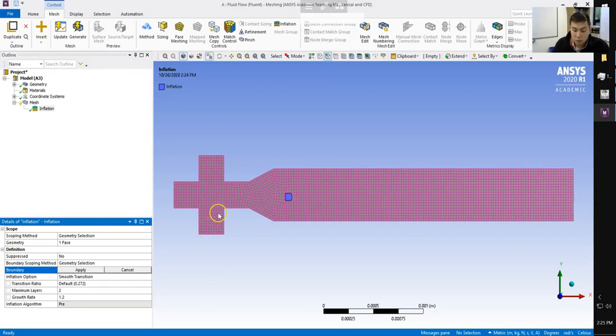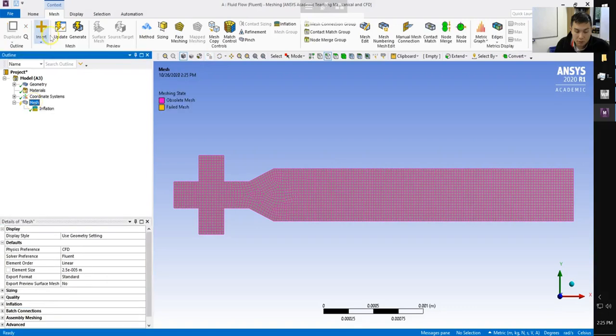So overall, we have 12 walls, and I'm going to just go ahead and scroll through and highlight them. So it's each of these 8 walls that form the plus sign, our 2 diagonal walls, our 2 long horizontal walls, and go ahead and apply. And so you see I've got 12 edges selected. And we're going to just simply increase the maximum layers from 2 to 5, and we'll keep the growth rate at 1.2, which is fine. Okay, so with that, we're done with our inflation, and we can update our geometry.